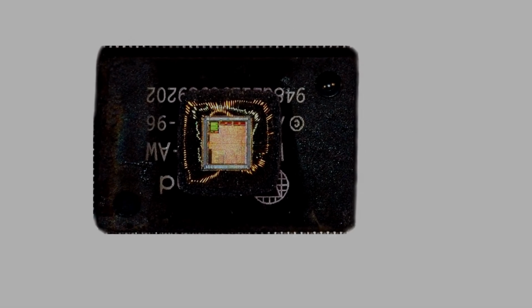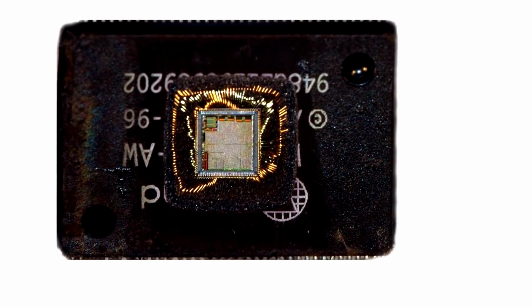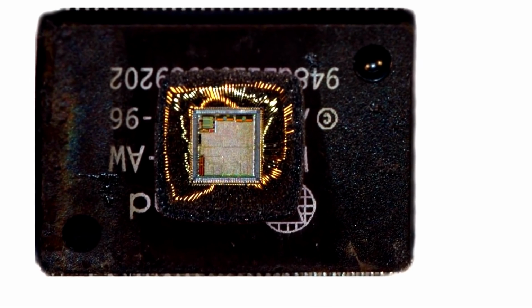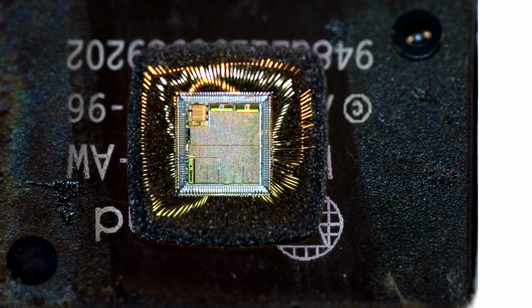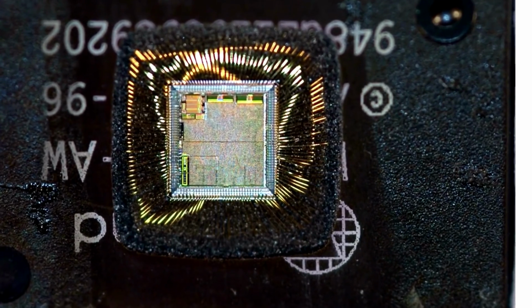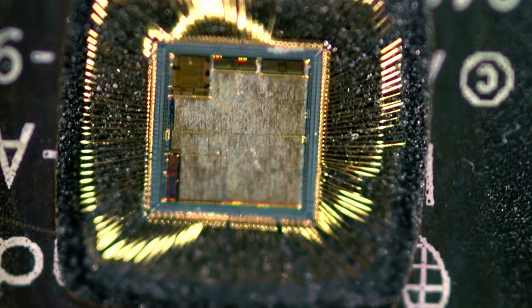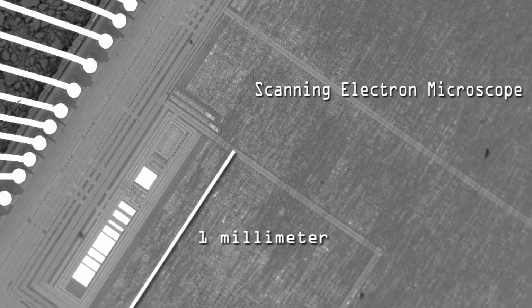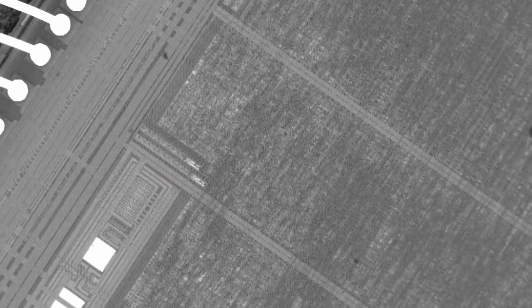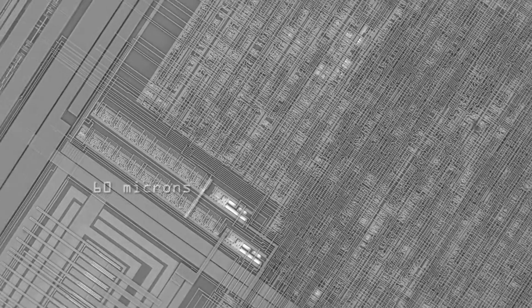Let's zoom into the microchip. The microchip you can find in every electronic object right now. You use your notebook, your cell phone, you're probably watching this video on one, television, desktop computer, and other electronic devices. If we look into this chip with the optical microscope again, we couldn't see as fine, but underneath this surface there's a network like a megapolis city: highways, intersections, towns.